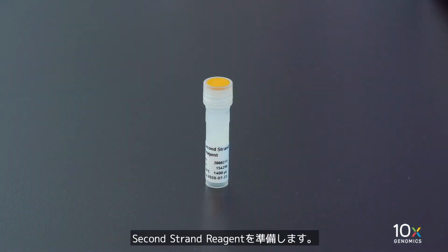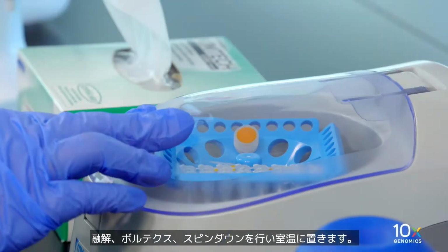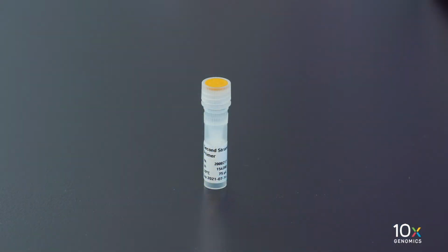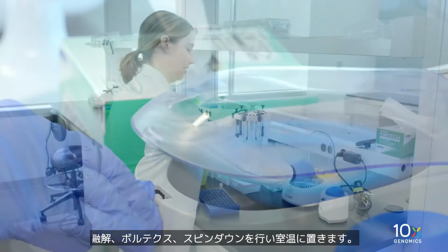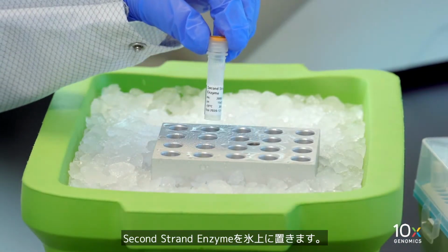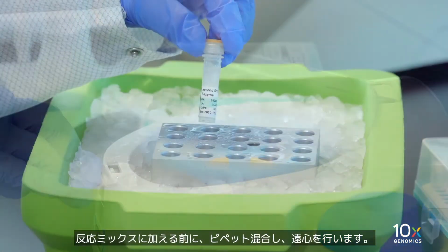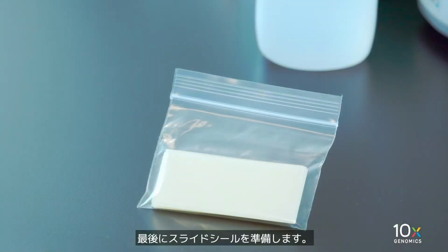We have second strand reagent: thaw, vortex, spin down briefly, and equilibrate to room temperature. We have second strand primer: thaw, vortex, spin down briefly, and equilibrate to room temperature. We have second strand enzyme on ice: pipette mix, spin down briefly, and place on ice before adding to the mix. Finally, we have slide seals.